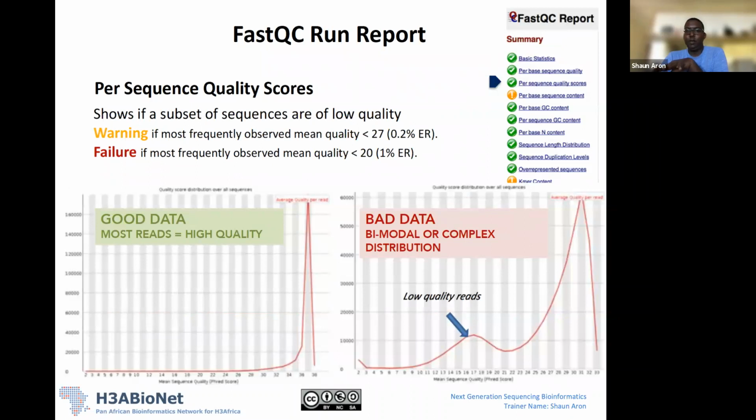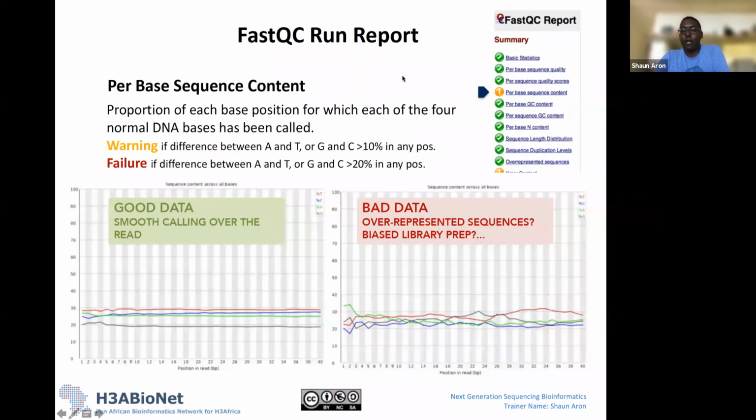So this is the per sequence quality score. The next part of the report is the per base sequence content. Okay. So what this is doing, on the y-axis is essentially a percentage from 0 to 100, and on the x-axis again is each position in our data set. So again, what it's doing is looking at each position in our data set, looking across all our reads. And now it's looking at the actual content. So what bases are we seeing at a particular position in our reads, okay?